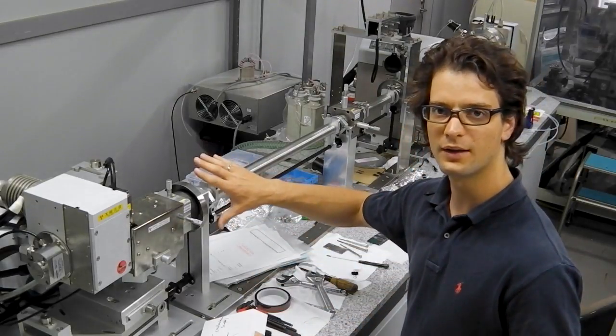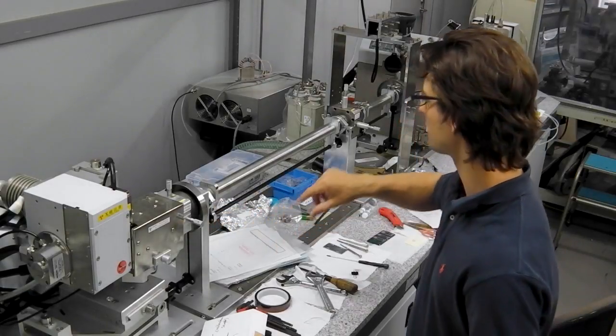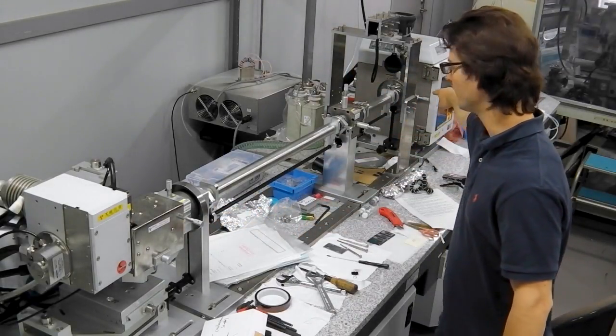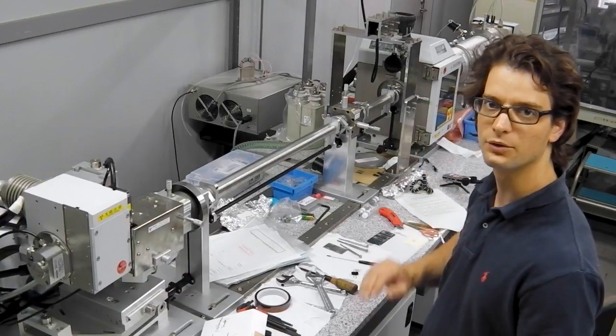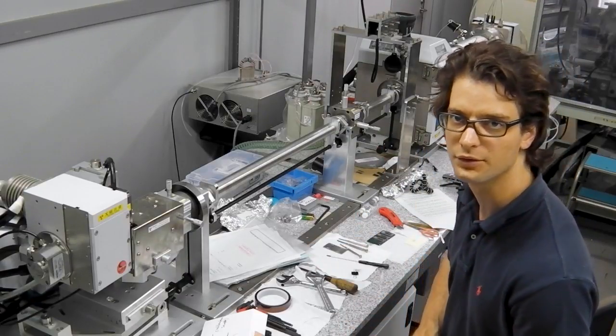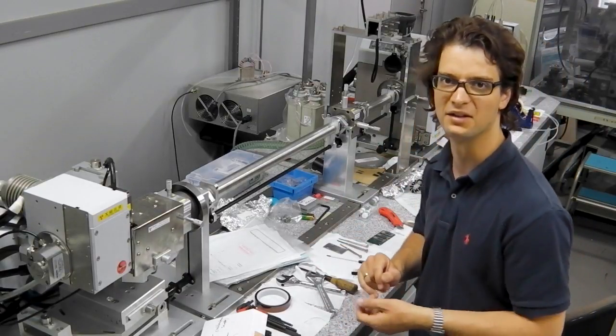And after this, you align the pinholes by means of these micrometer screws here, here and over there. So this system has three pinholes, which is the standard number of pinholes for any sort of 1990s instrument.